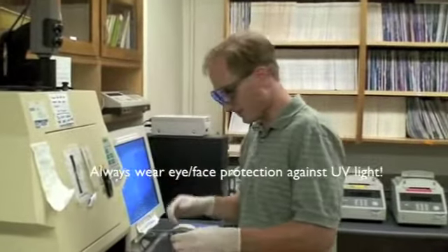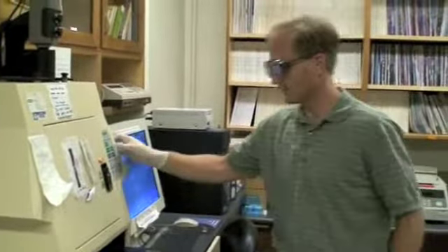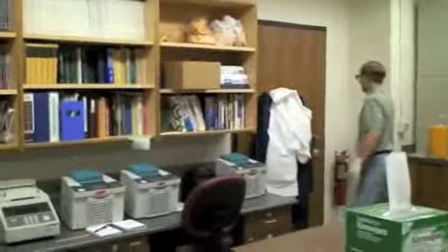So I just put these goggles on top of my glasses. We need to turn out the lights again, and then turn on the Transilluminator. No one else is in here, so I'm not asking, but if someone else is in here, be sure and ask.